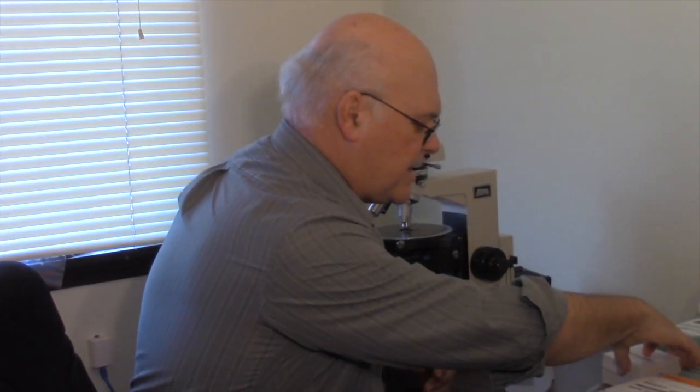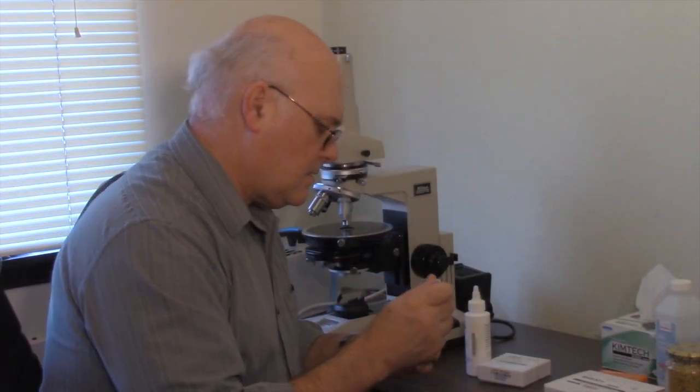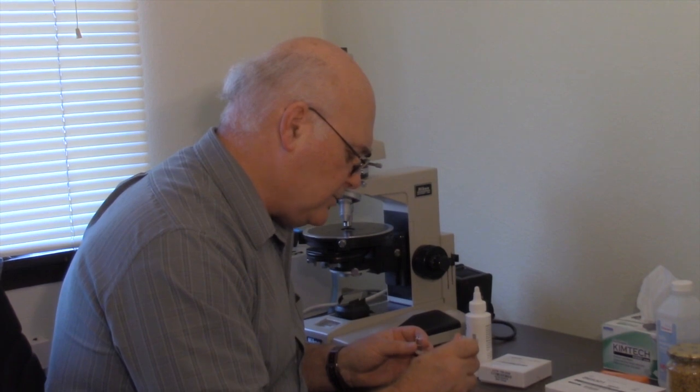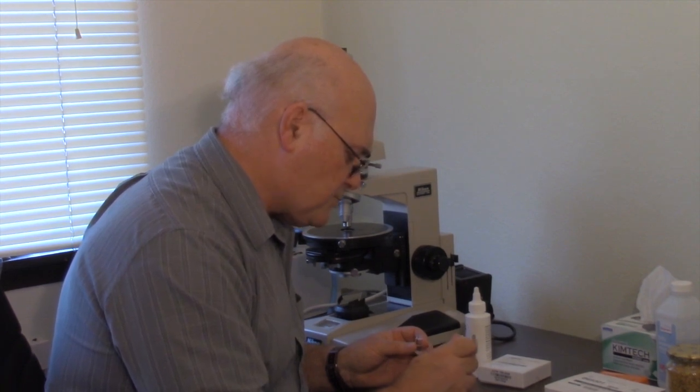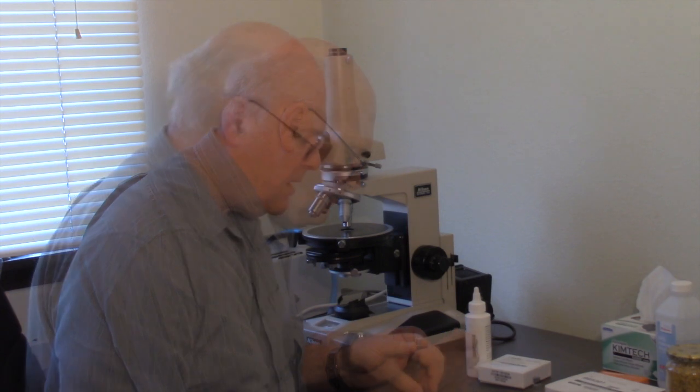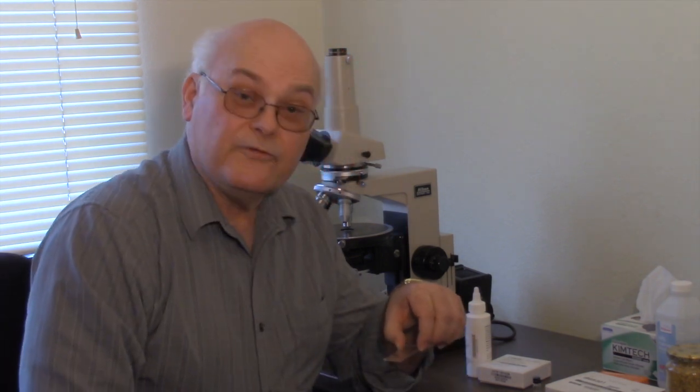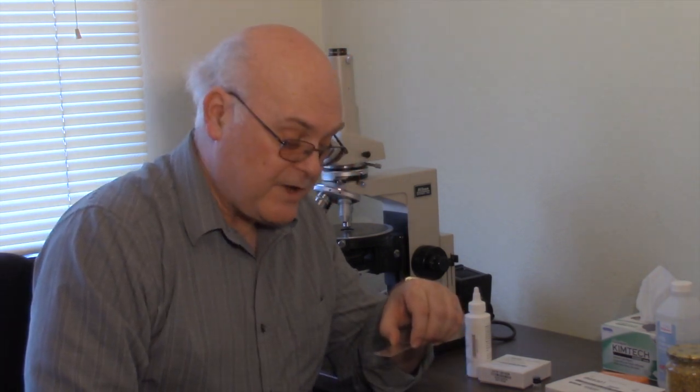We can now take a microscope slide, collect a few drops, and spread it out on the slide. Let the alcohol evaporate, and after it's evaporated, we can make our mount.